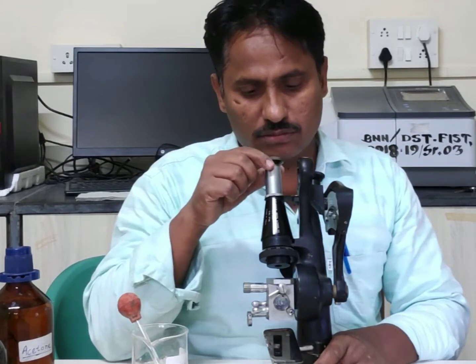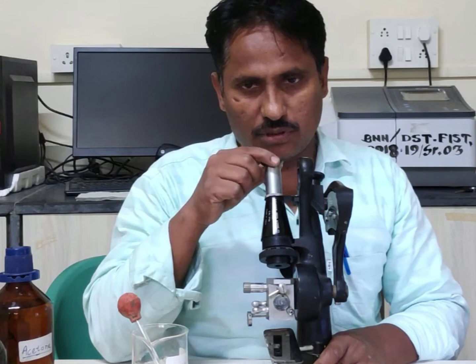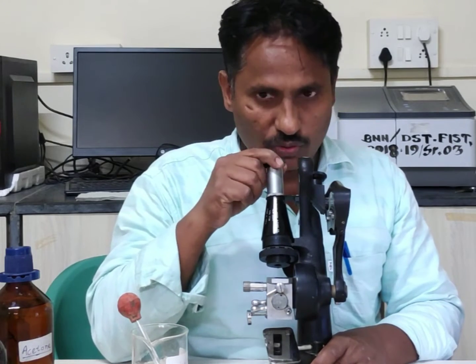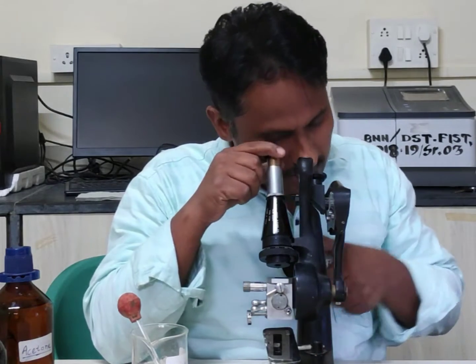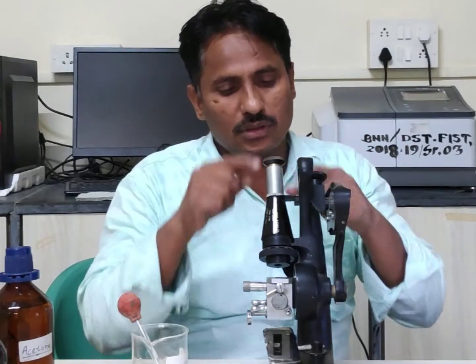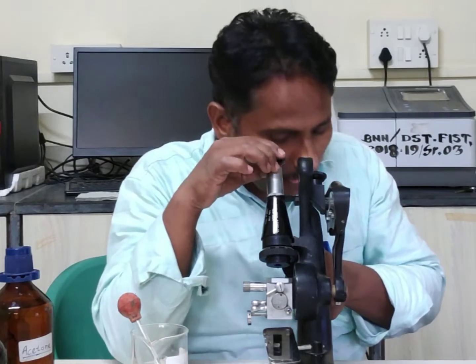At this eyepiece, look very carefully. We can see two crosslines on this telescope.